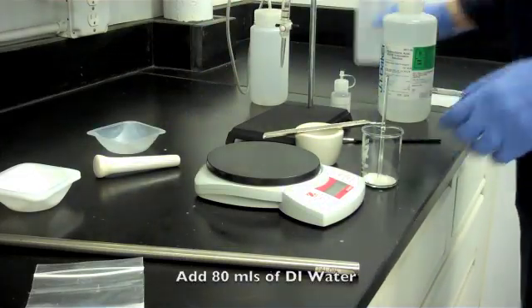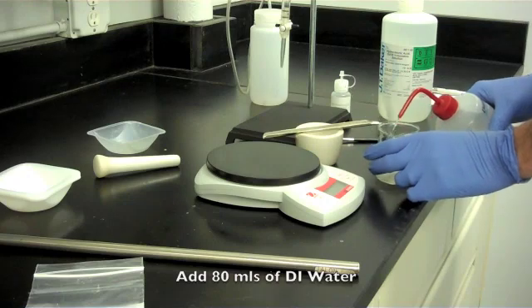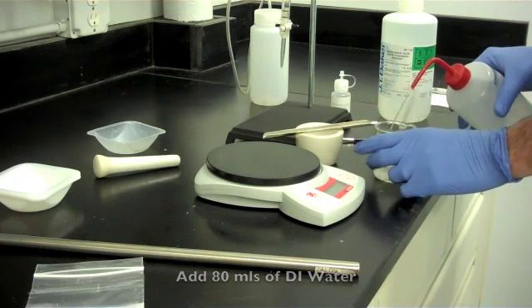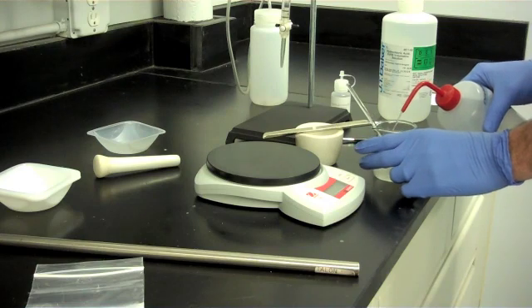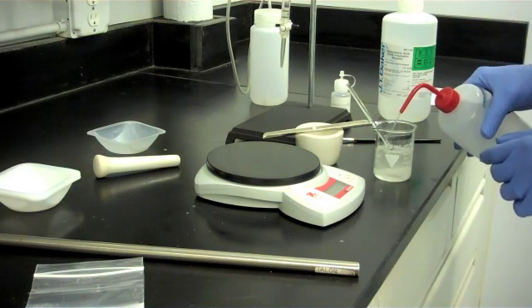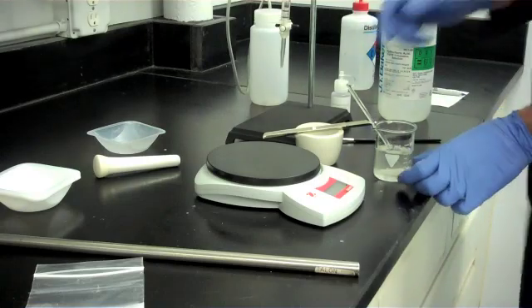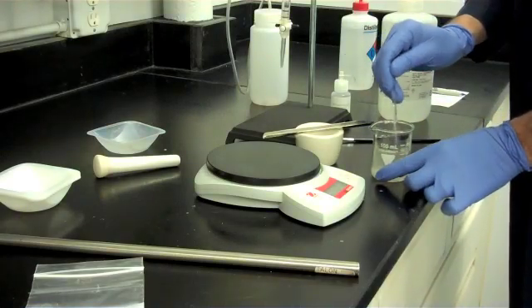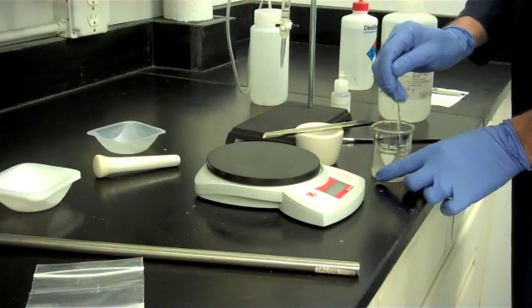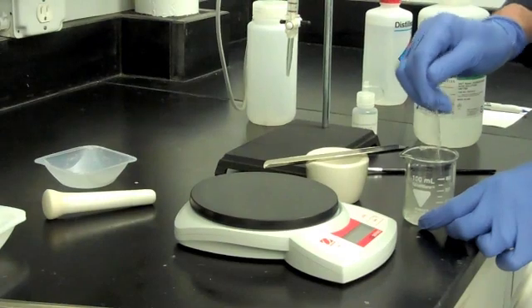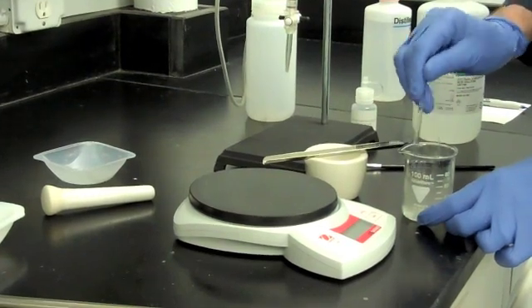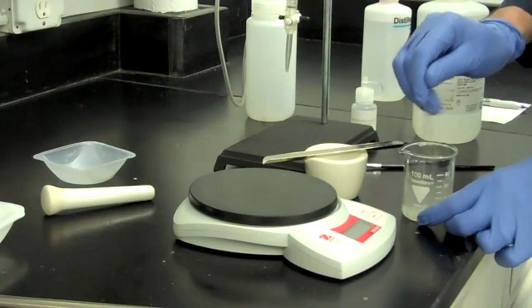Add approximately 80 ml of DI water. DI water must be used in this titration, but it is not supplied with the test kit. With the use of the stirring rod, agitate the sample until all the salt is in solution. The salt must be entirely into solution before the solution is titrated.